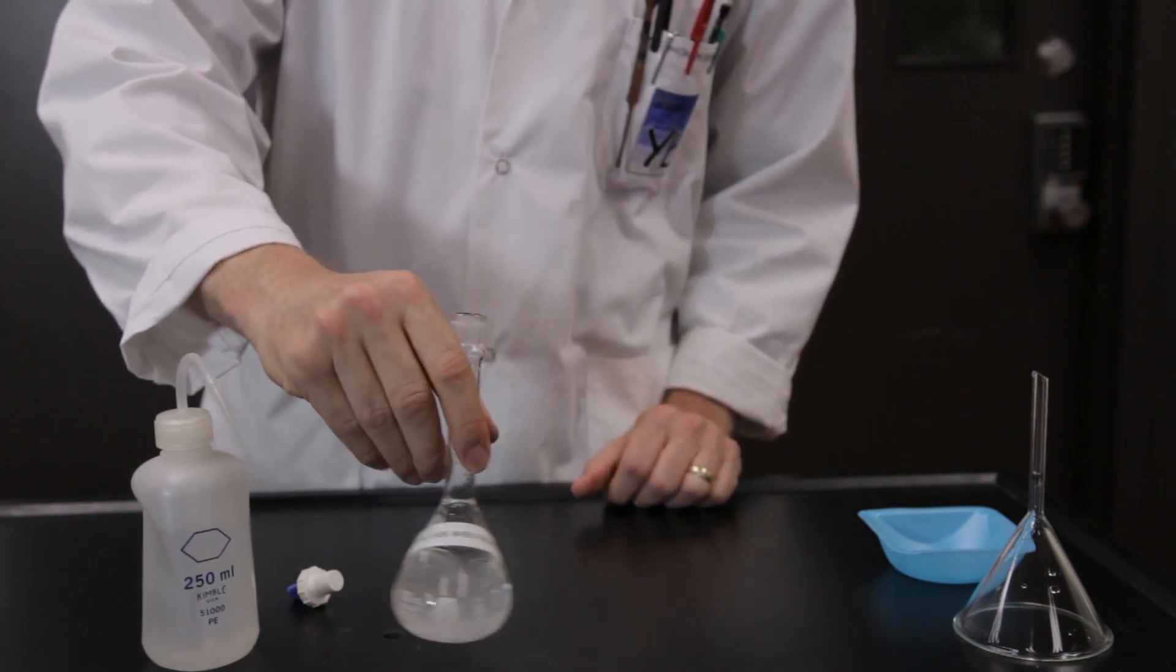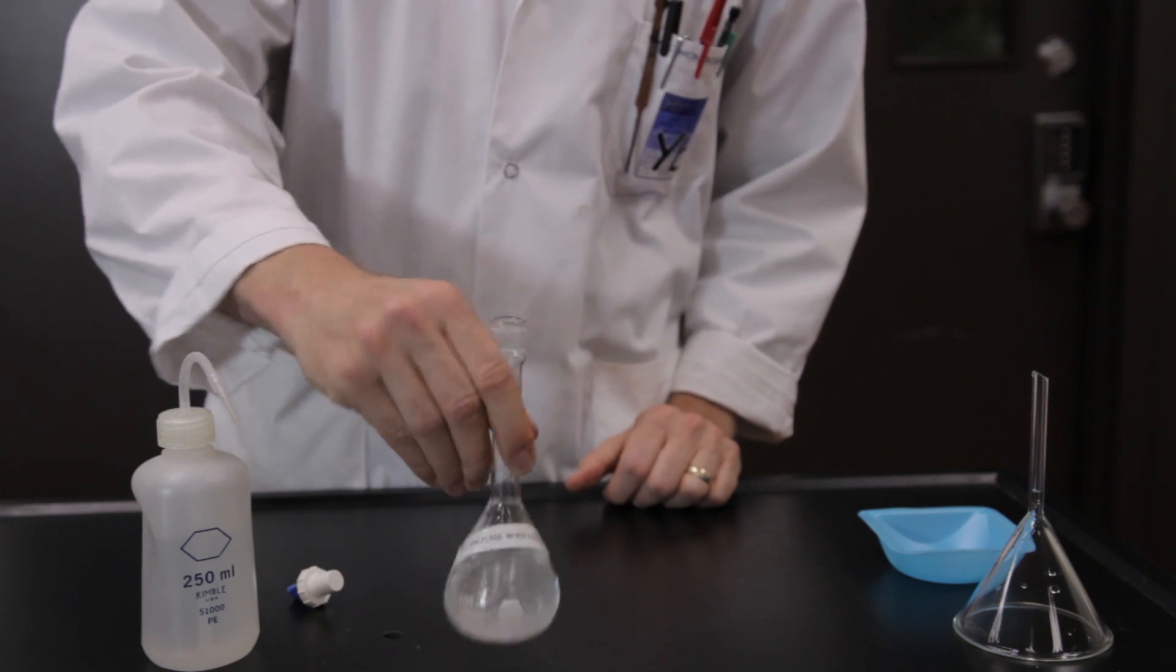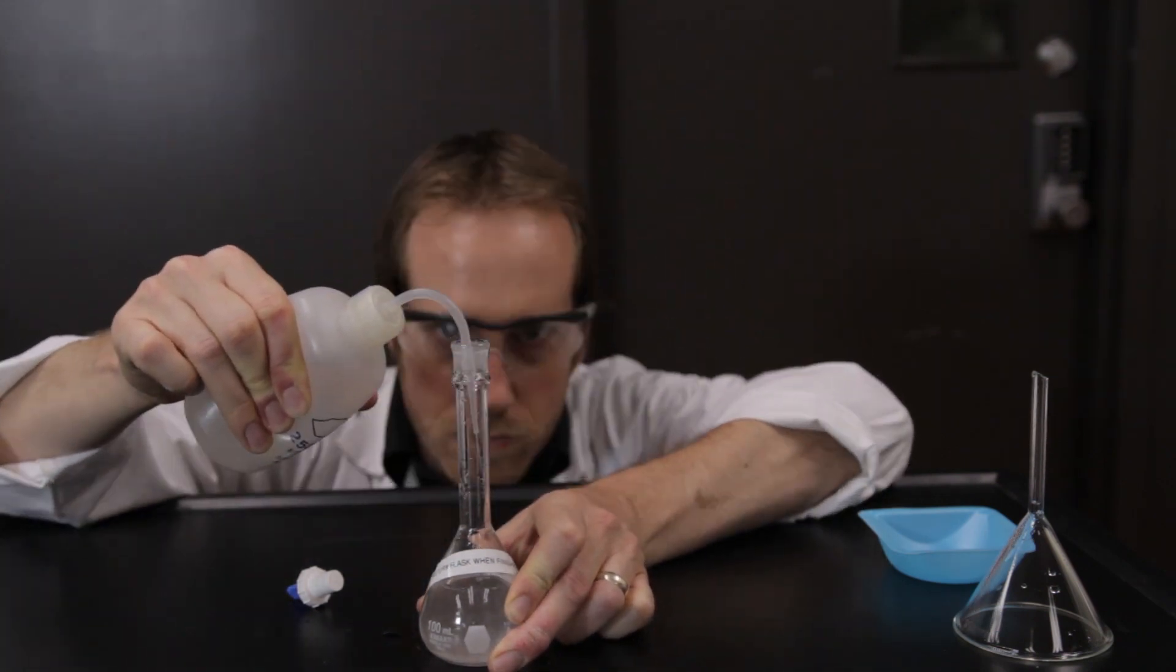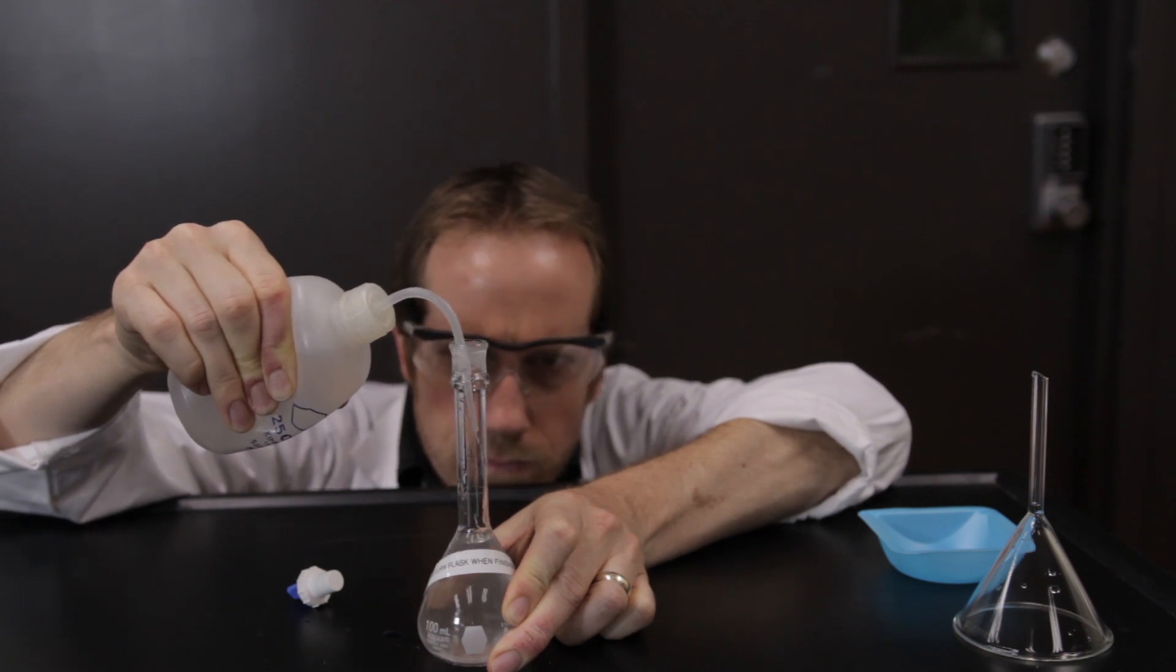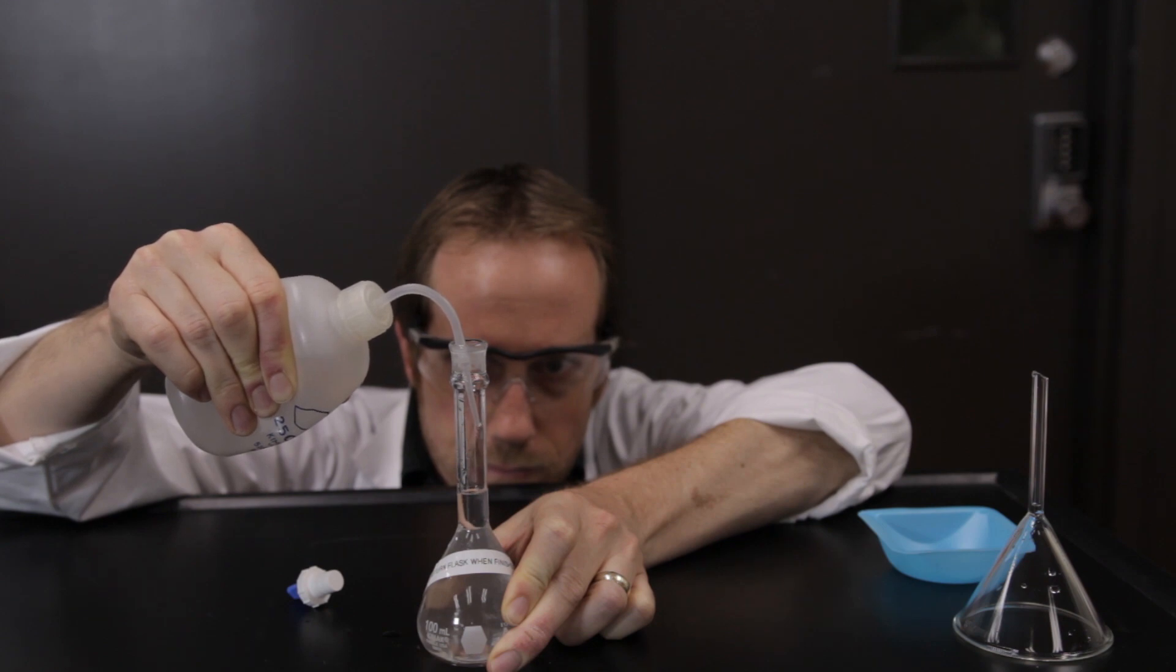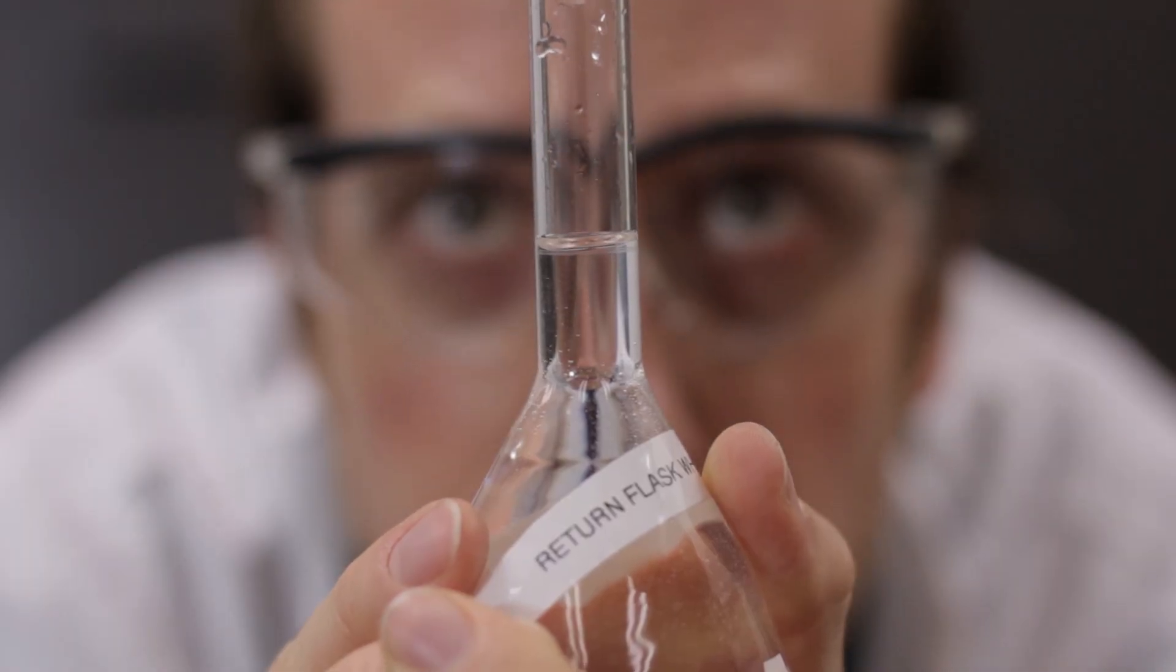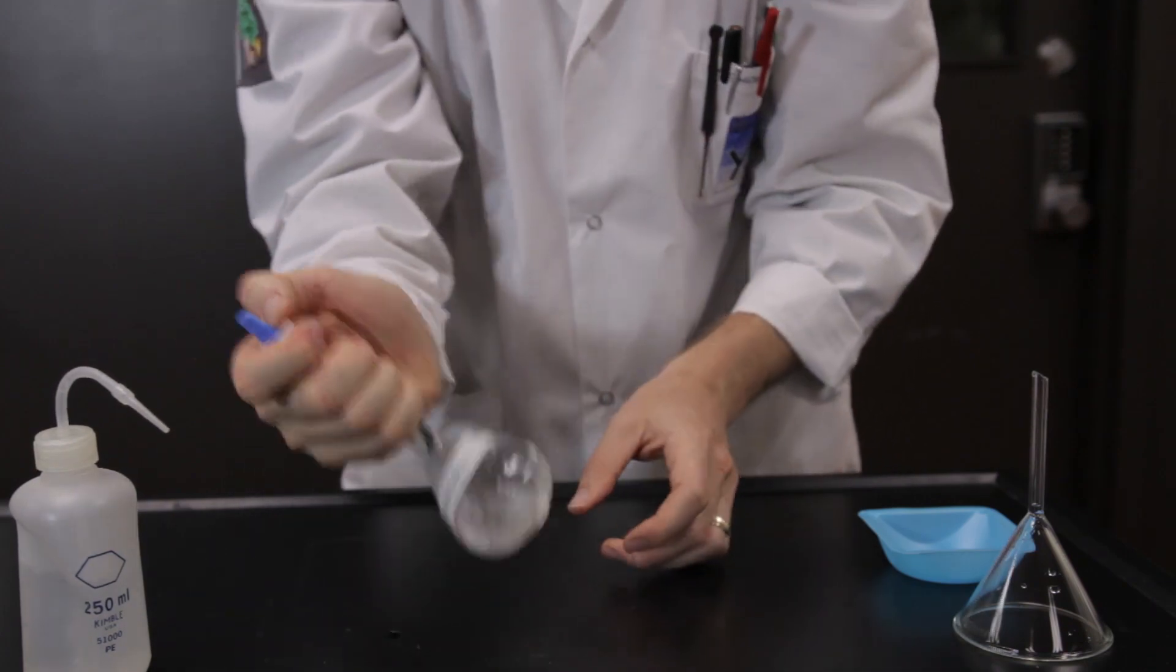Swirl gently to dissolve the solid completely, and then add more distilled water to the mark. Make sure the bottom of the meniscus is at the mark at eye level. Mix the solution thoroughly.